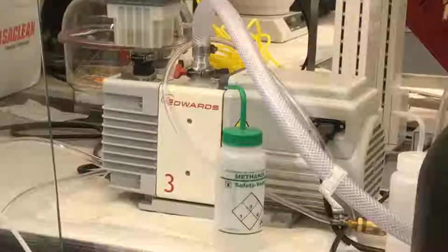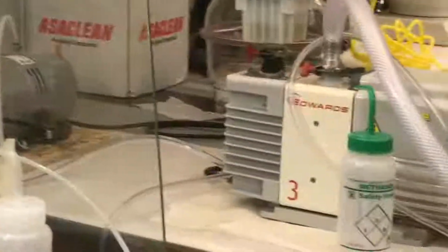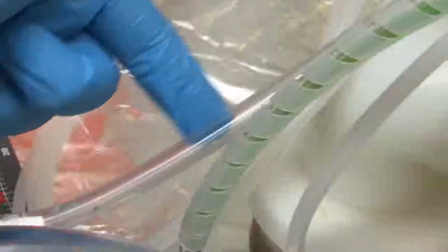This pump is connected to the desiccator. Where are the connections? From here it goes inside, and from here it goes to the pump. These two. This one is coming inside the desiccator. Yes. Okay, I can pause it now.